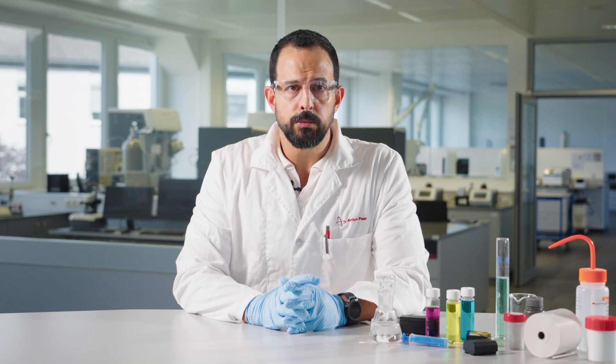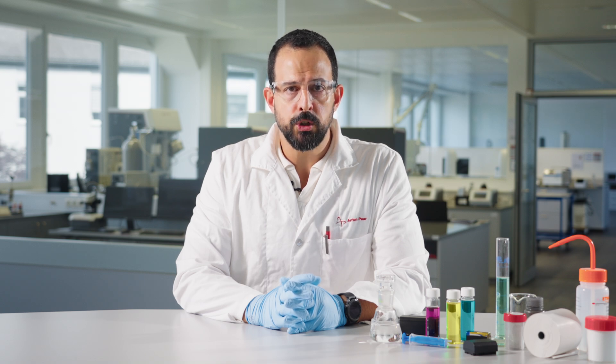Let's now take a look at the viscosity of electrolyte solutions. In the development of new electrolytes, viscosity measurements are typically performed over a wide temperature range or at a single temperature. Viscosity is an important indicator of the degree of wettability of the electrodes by the electrolyte, as this will have an effect on ion transport and consequently the charge and discharge rate over a specific temperature range.